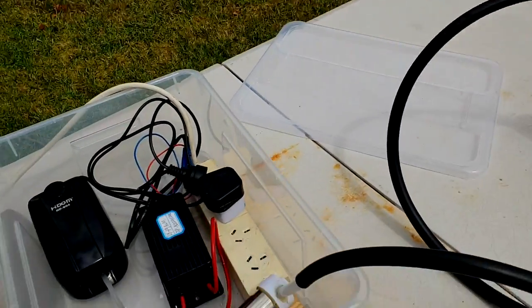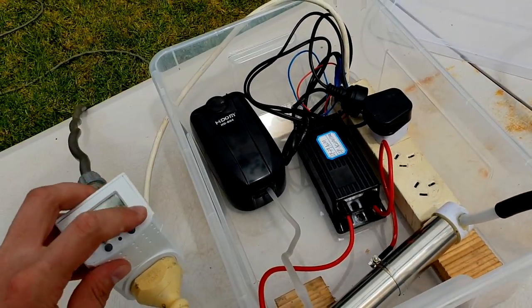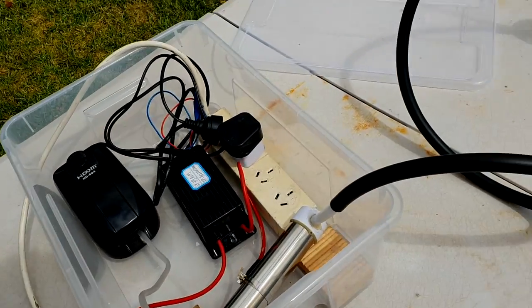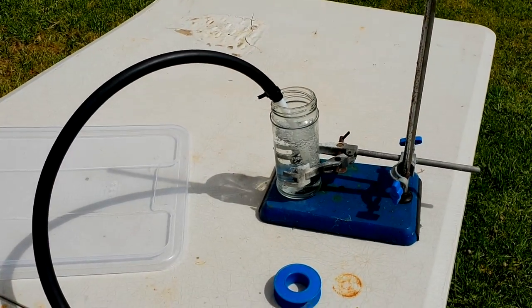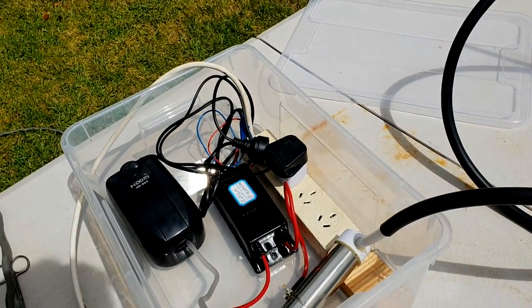All right, so we've just got some water in there just to show that the system is all working fine. Chuck it on. The ozone generator isn't plugged in, but that's a great bubbling rate. I don't think we'll have to stir that. So that should be all good.